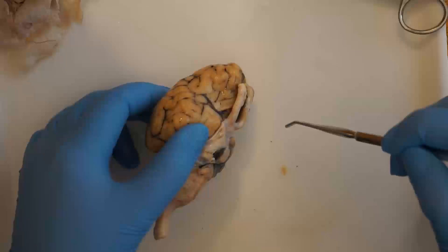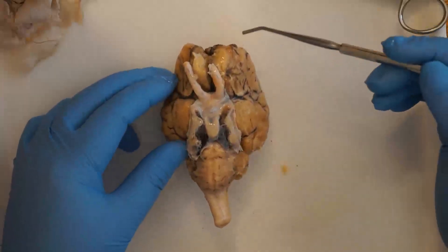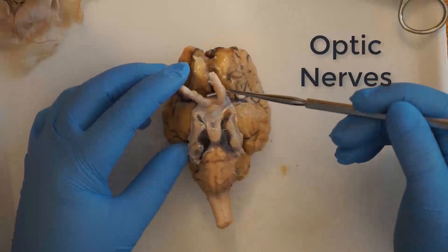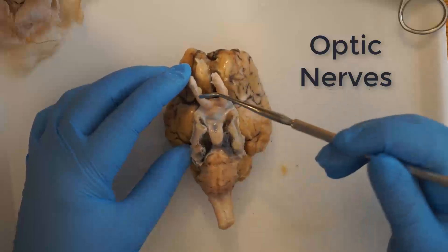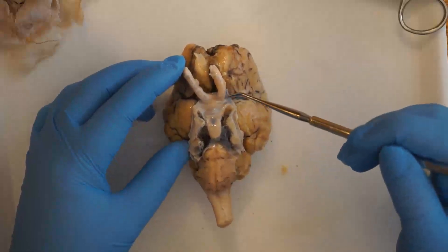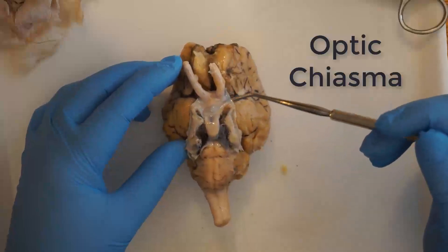If you flip your brain over, you'll see some features on the underside. We have the optic nerves, which bring in impulses from the eyes of the sheep, and they cross over as they reach the brain at the optic chiasma.